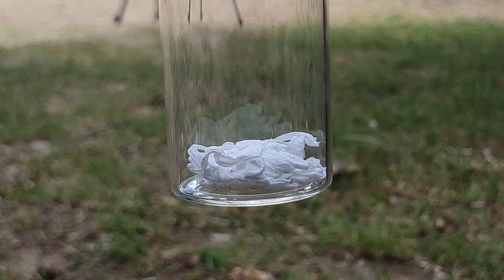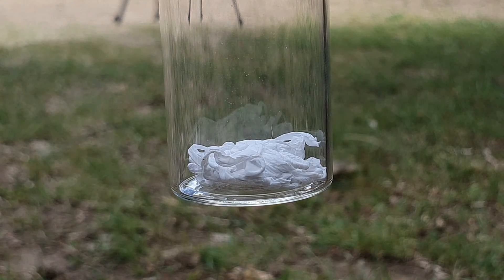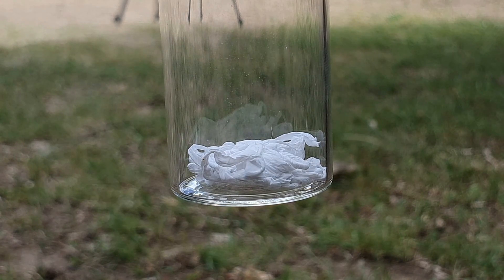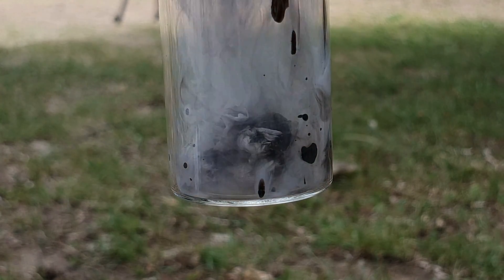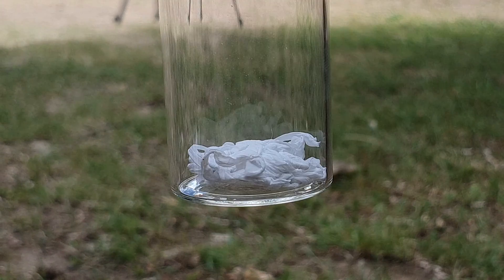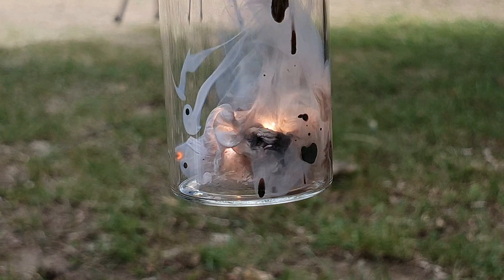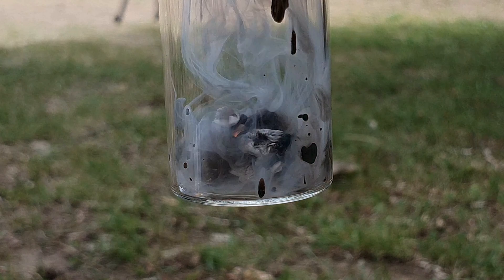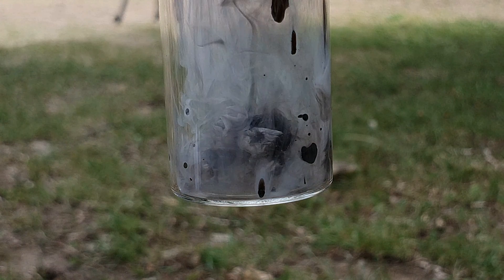In my video about the cesium isolation, I warned you about the usage of Teflon, also known as PTFE, as a thread sealant. And this is the reason why. What you see here is the cesium defluorinating the Teflon. We are not sure if this reaction would look the same without oxygen present, so we will explore it further in a future video.